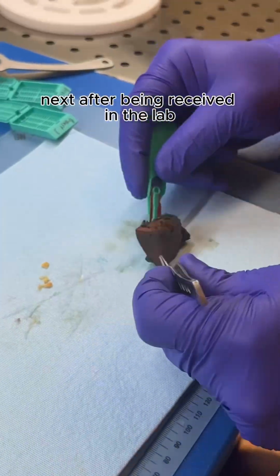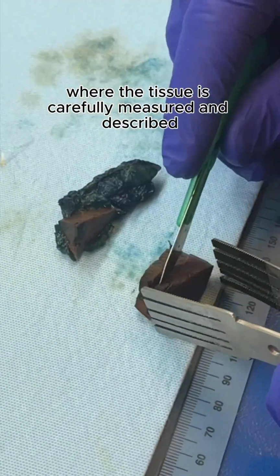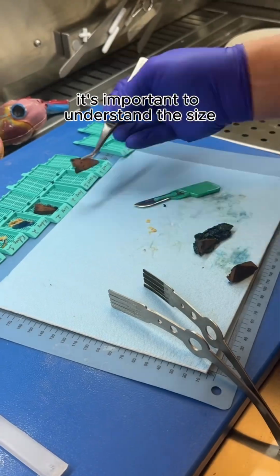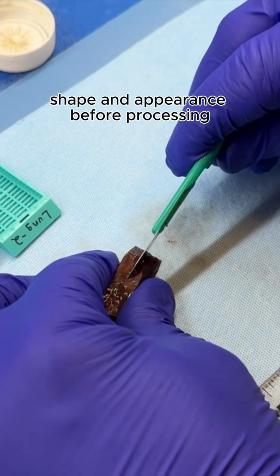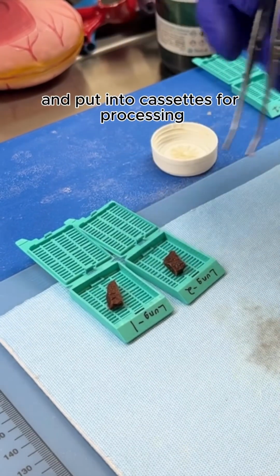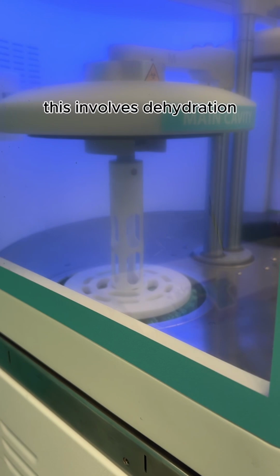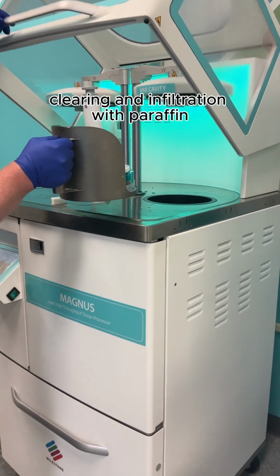Next, after being received in the lab, the specimen is examined during the grossing step, where the tissue is carefully measured and described. It's important to understand the size, shape, and appearance before processing. The sample is now cut and put into cassettes for processing. After grossing, the tissue goes through processing. This involves dehydration, clearing, and infiltration with paraffin.